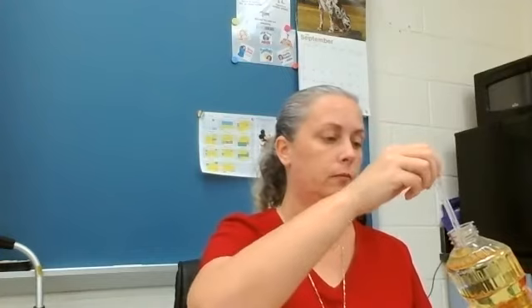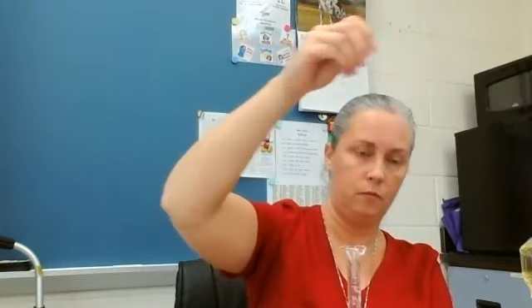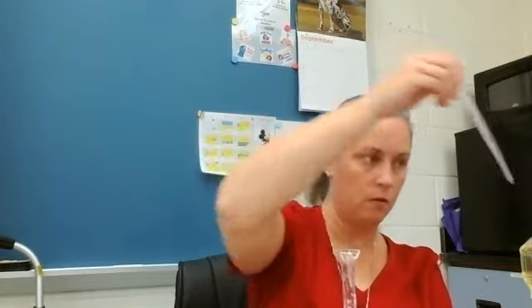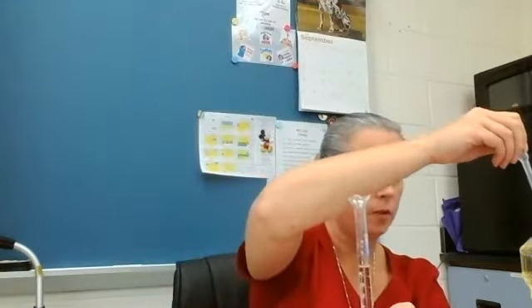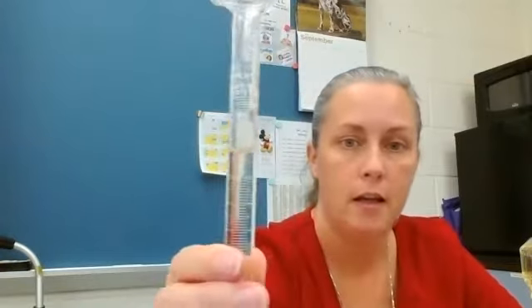We're going to put eight ml of cooking oil in that graduated cylinder. I grabbed a couple more cylinders — I still have this one, and we're going to set it aside. Now I'm going to add eight ml of cooking oil into this one. We are at exactly eight mls — that's our oil.